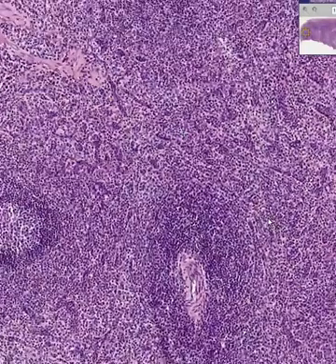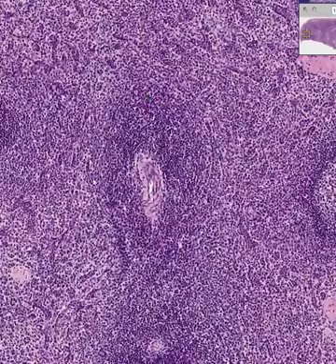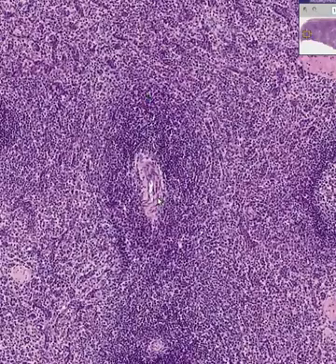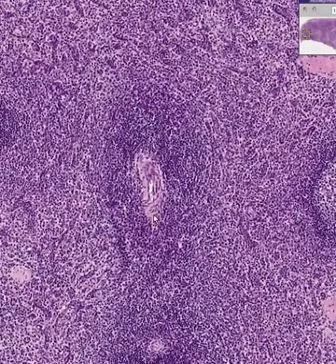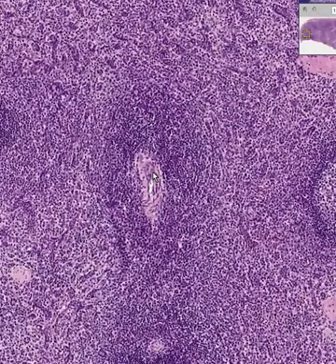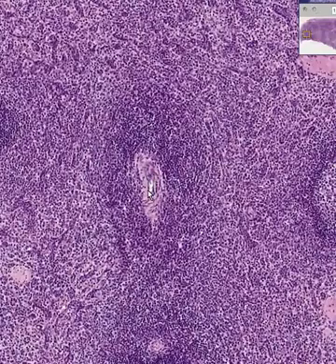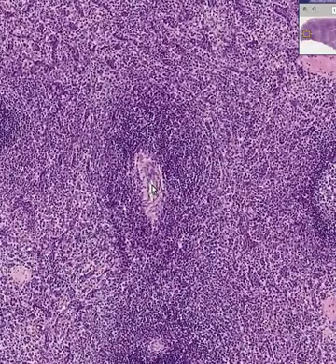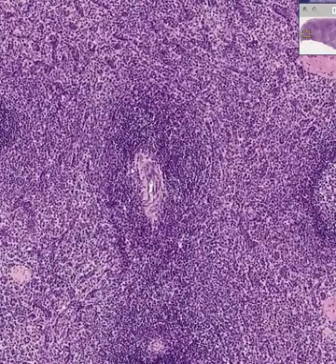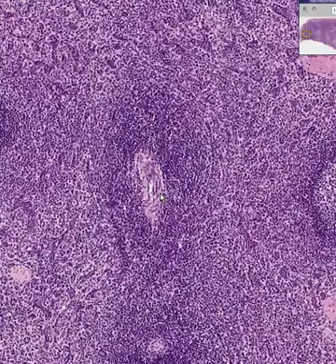There's another structure I want to point out here. It looks like a lymphoid follicle, but in the center there's a fairly thick-walled blood vessel. This is called a central artery, and it's named so because these vessels run in the center of these lymphoid areas.